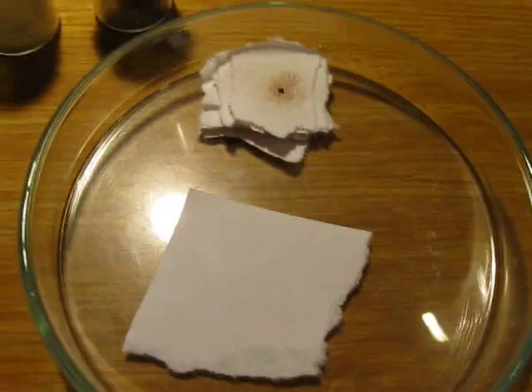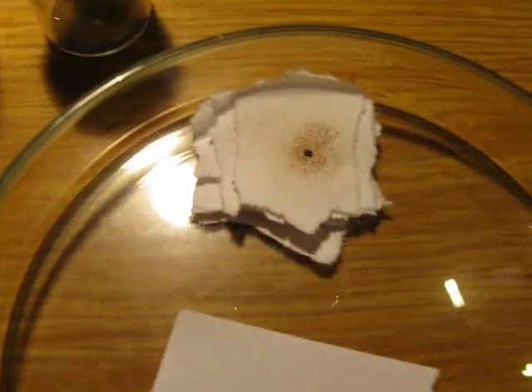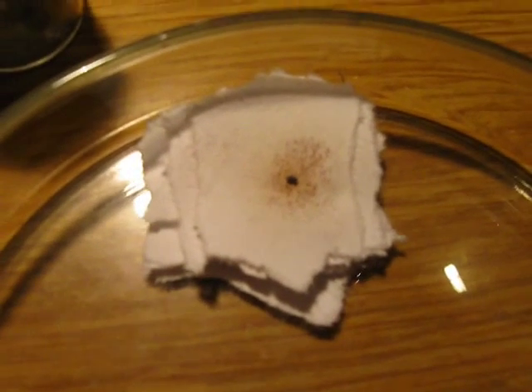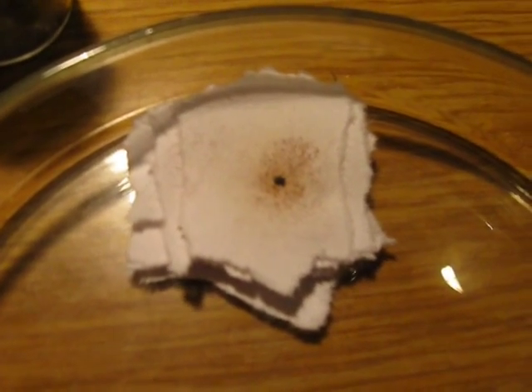Well, as you can clearly see, it was the iodine causing that spot, and it left quite an interesting shape. Let's see what this is all about and place a large chunk of iodine on here.